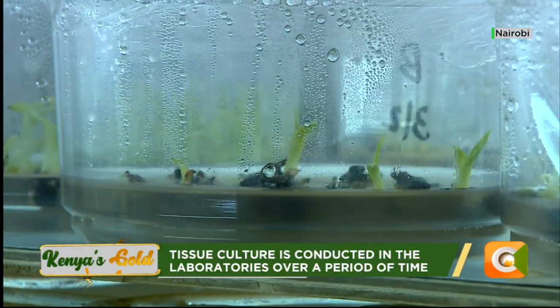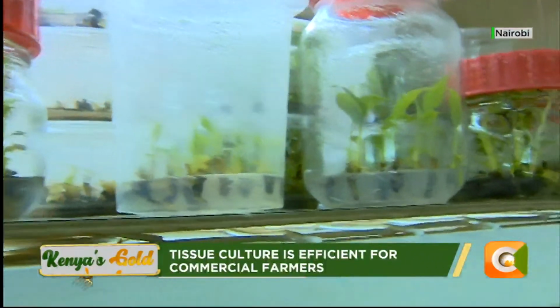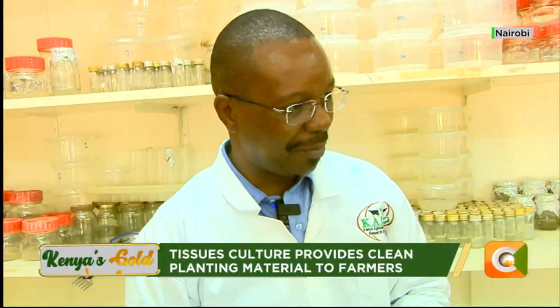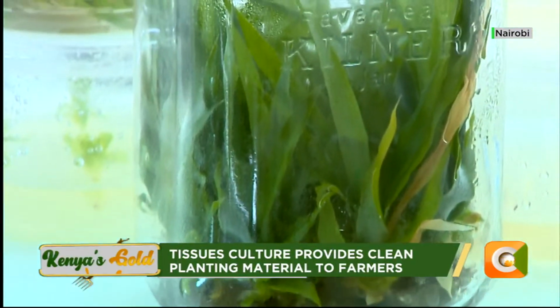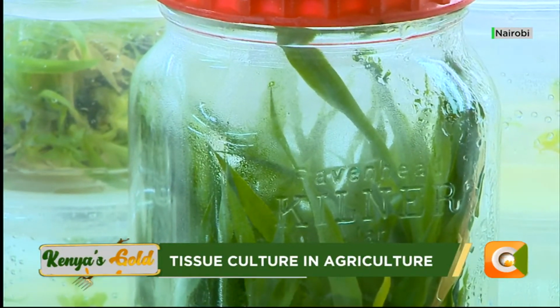So we have several other crops, like cassava, sweet potato vines. We can also give you pineapple, which I think I mentioned. Right, yeah. Pineapple. Now we are working on vanilla, and also we have introduced plantain. Plantain is where we are now in the final stages, looking at just the commercial aspect, to be able to multiply. We have optimized the protocol. We are at the point of just being able to multiply and provide our farmers with enough plantain.